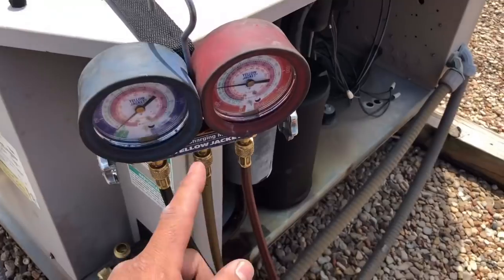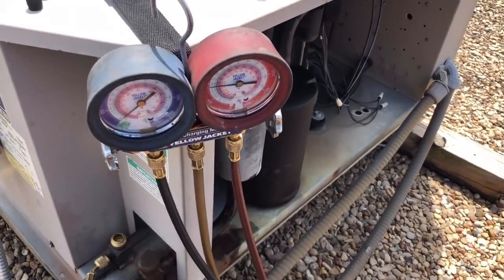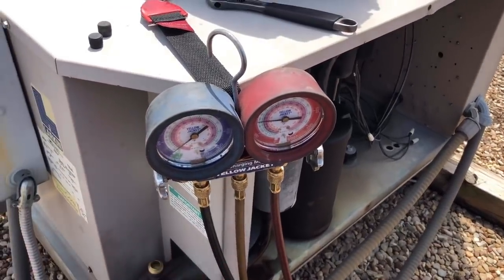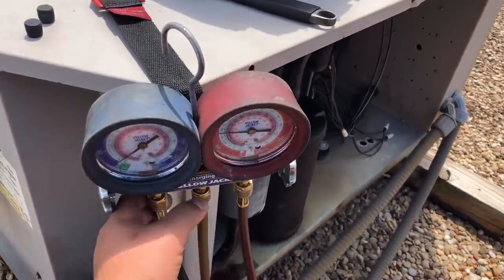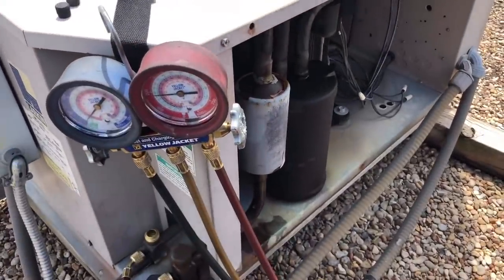So we cleared the sight glass, added a little bit more charge. I'll probably add a couple more squirts just in case it decides to leak out between now and Monday. That's what I mean by a safe pump down — I had a couple of questions on it a couple videos ago.